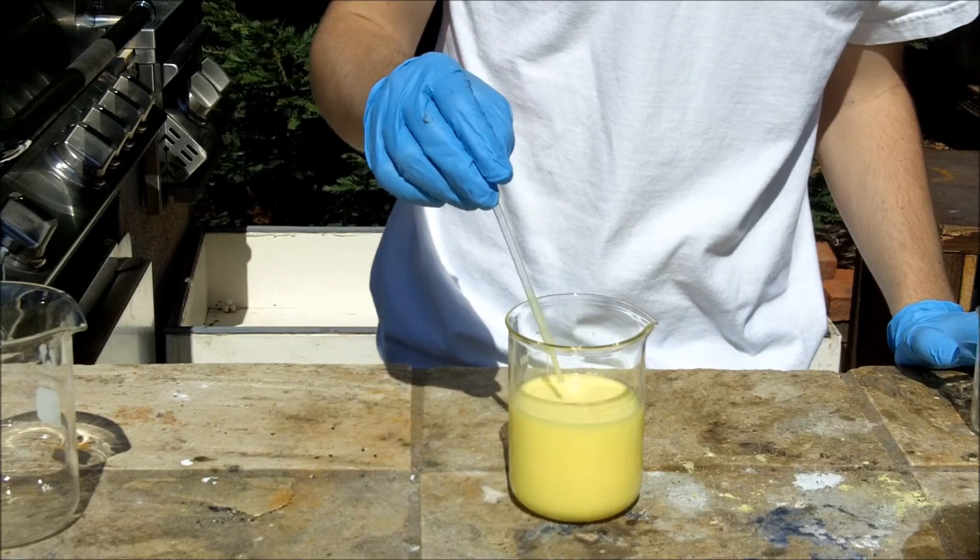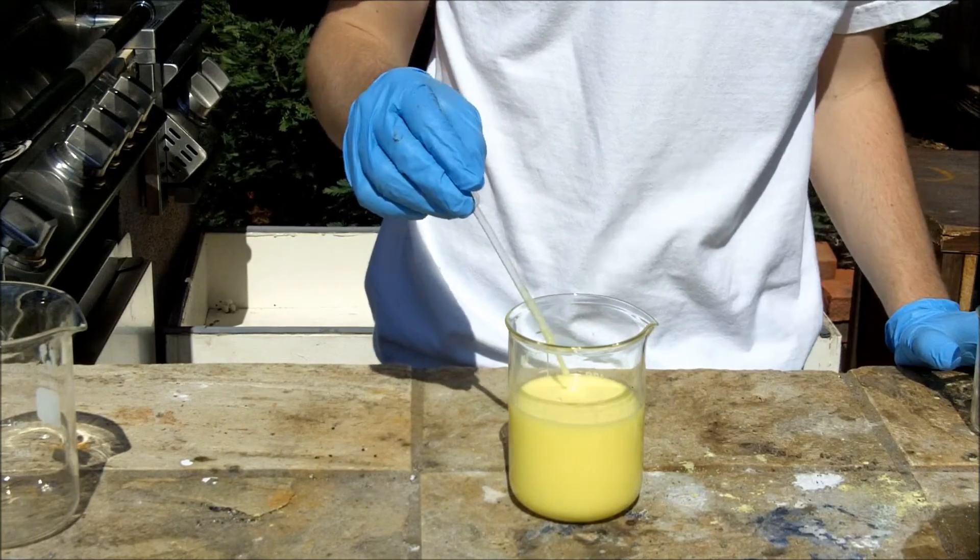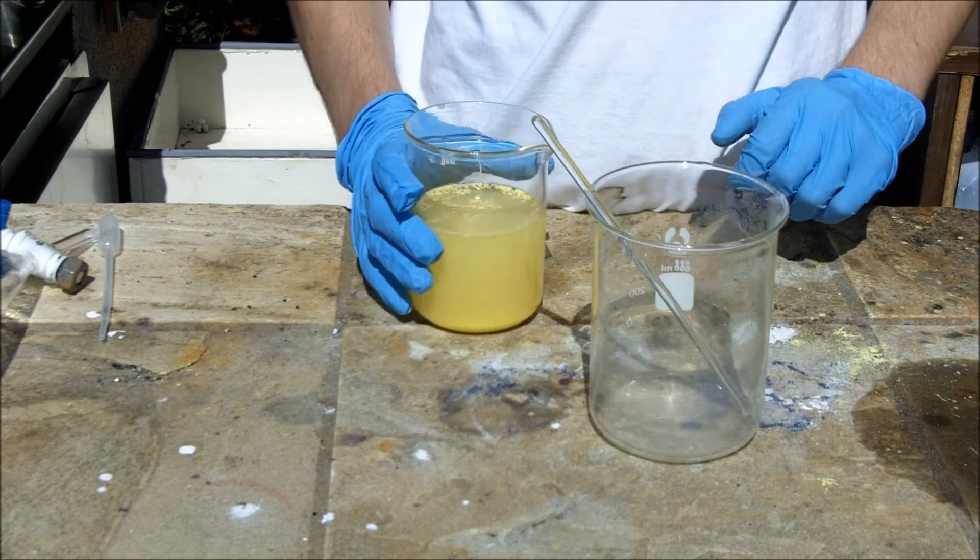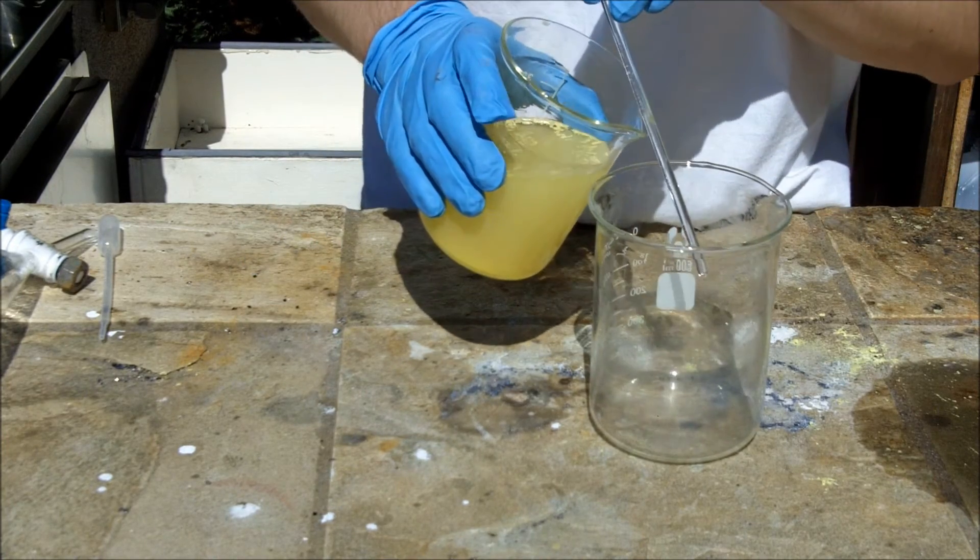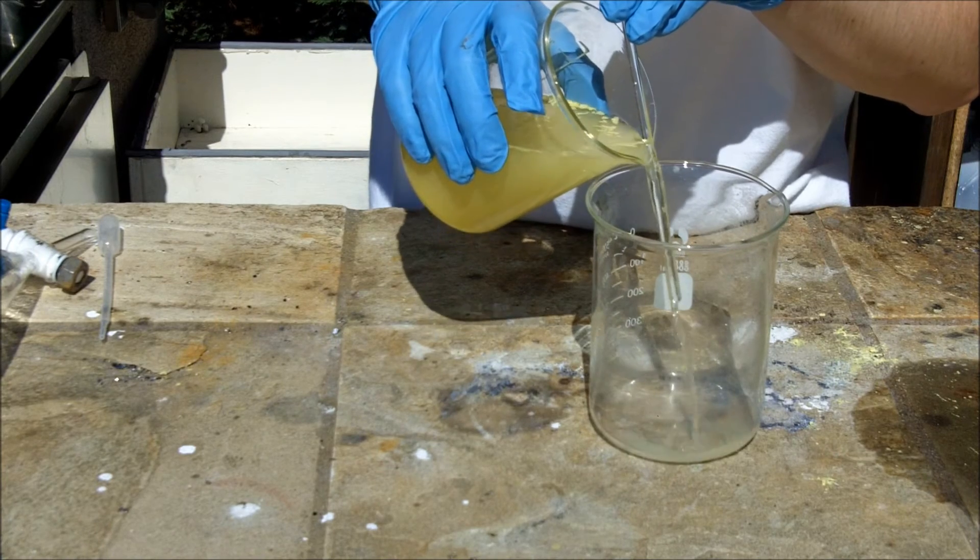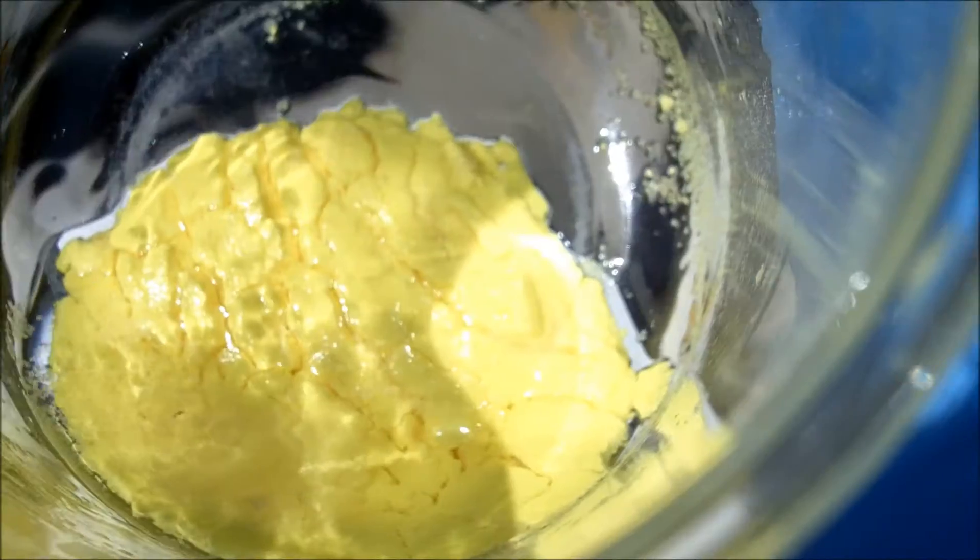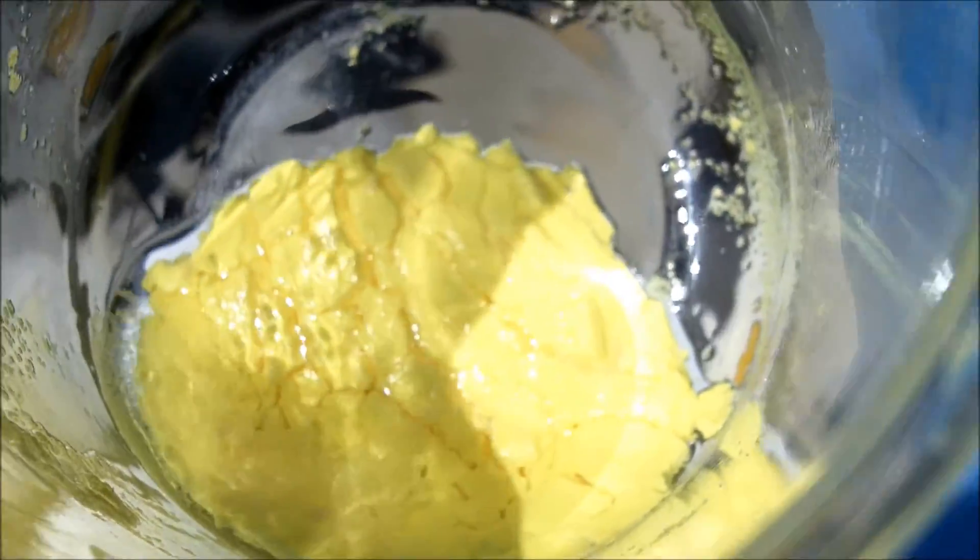Again, like the bromoform, I'm going to let this sit for a while and allow the iodoform to collect on the bottom. After letting the iodoform solution stand for a few minutes, I'll decant off the precipitate I got at the bottom. Here's what I collected.